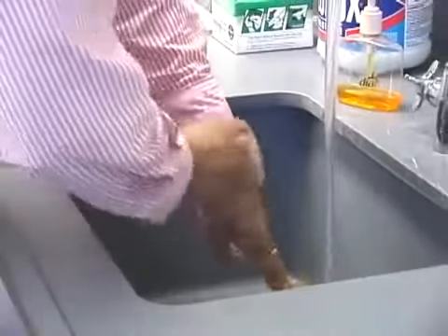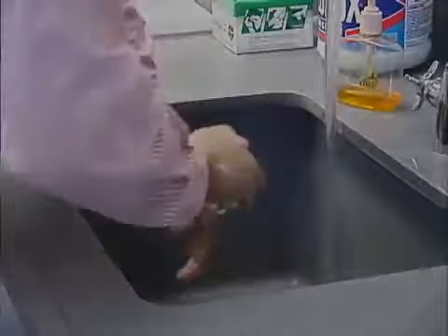And don't forget to inform others that they can return to work now that the spill has been safely cleaned up.